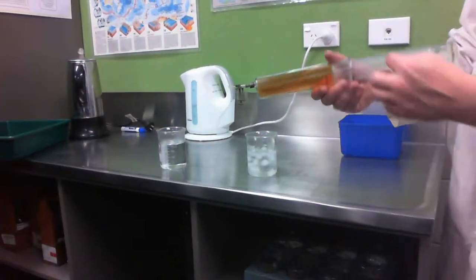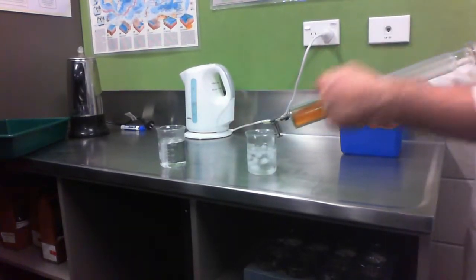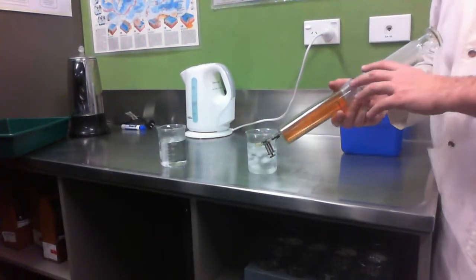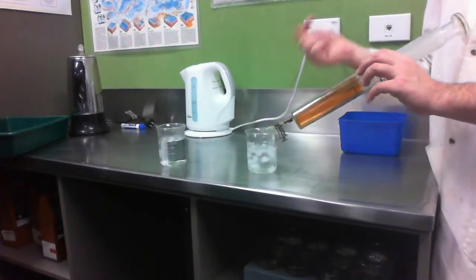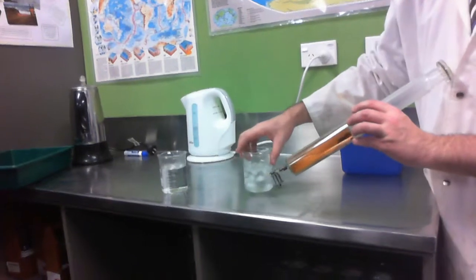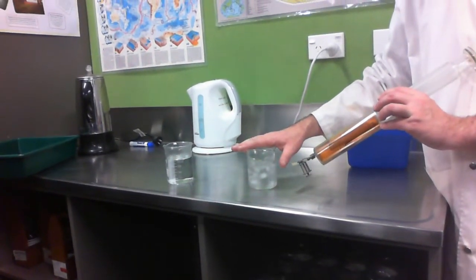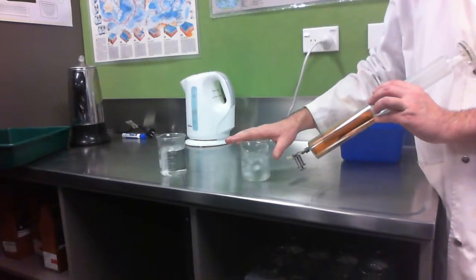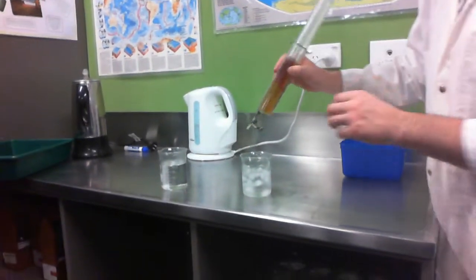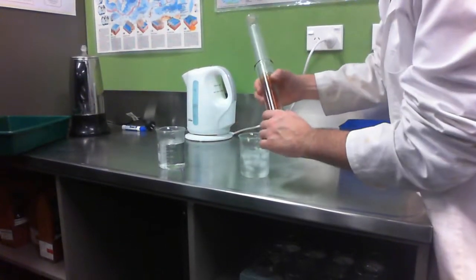So by seeing what happens both to the position of the syringe and the colour in here, we should be able to see or predict which one is endothermic, which reaction, the forward or reverse, and which one is exothermic. So first we'll go into iced water. So this is going to favour which reaction? Exothermic, because it's going to try and heat the system up again. Okay, so typical, it's going to be difficult to do with what we've got here.